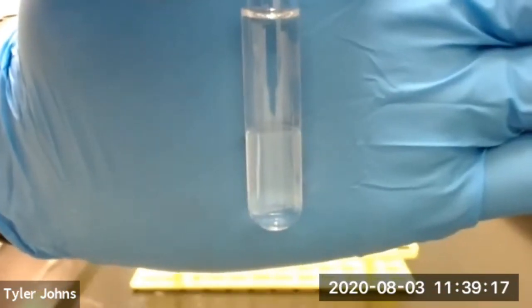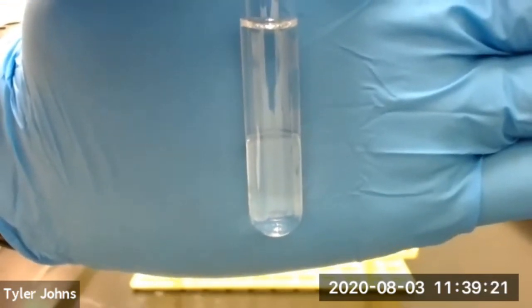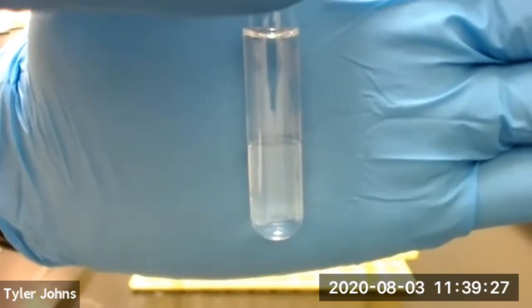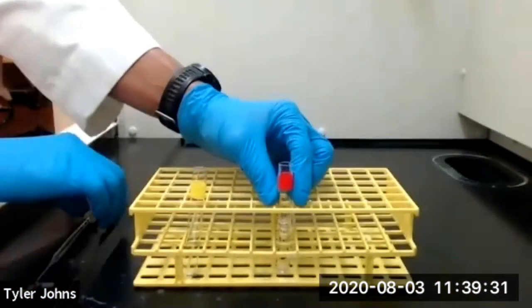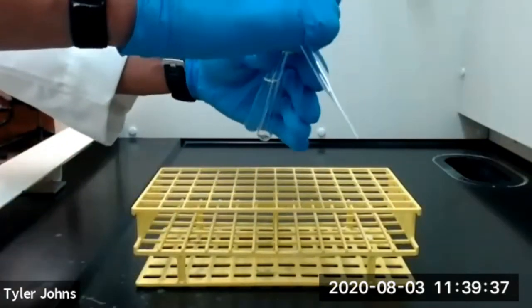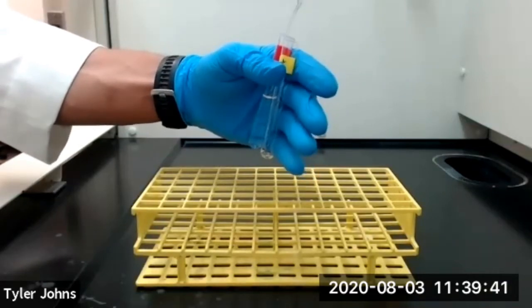You first need to predict which layer is the methylene chloride and which layer is the 1 molar sodium hydroxide. And then you'll need to justify your predictions. So what I'm going to do first is take a Pasteur pipette and transfer the bottom layer from our test tube to a new test tube.